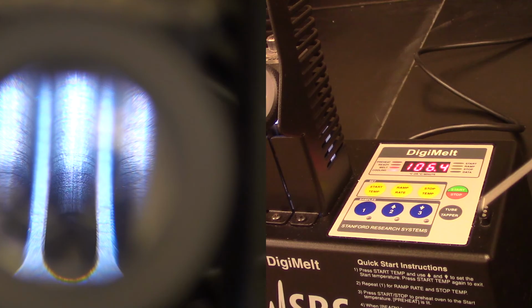You can take your melting point tube and throw it in the broken glass. If you think you want to repeat your experiment, that is fine. You can make up another tube. Do not use the same melting point tube, though. You have to start with a fresh sample.